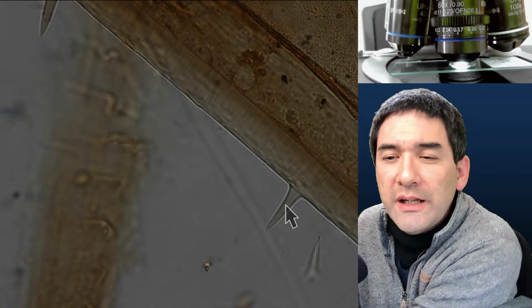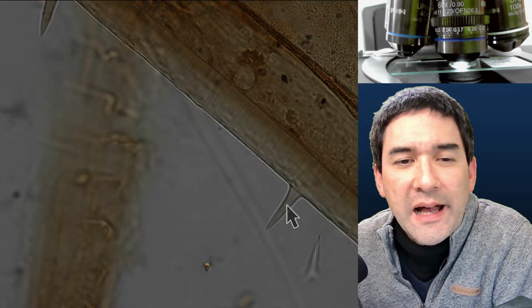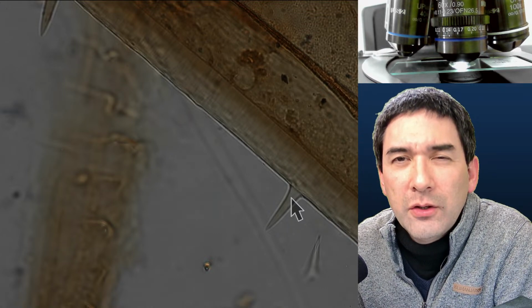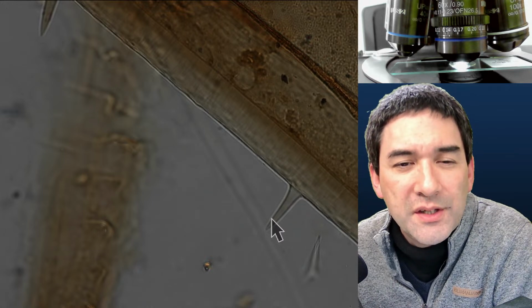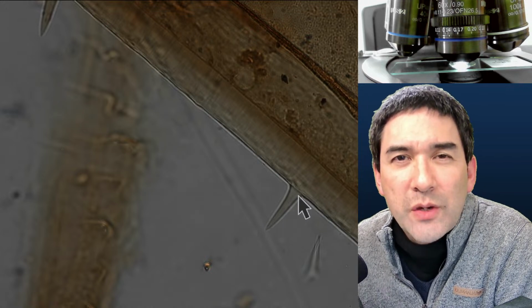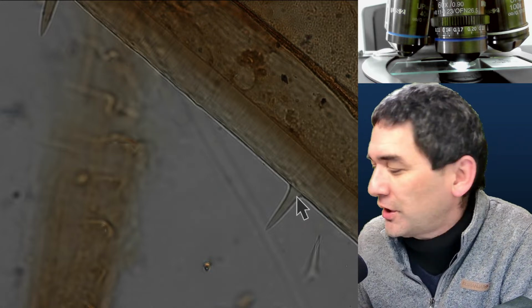So the question is to know what resolution your lenses have. Let's put it this way. I could do that, but I would say that those specimens here are probably not the best ones because they're fairly thick. To do a lens resolution test, normally you use the shells of diatoms because they have very fine structures.